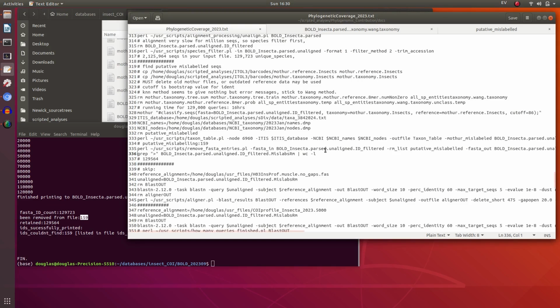But anyway, I ran this on 129,000 sequences of the updated COI database for insects. Its slowest step is running Mothur, so it took 16 hours, overnight, and then we remove 159, and okay, that's job done.